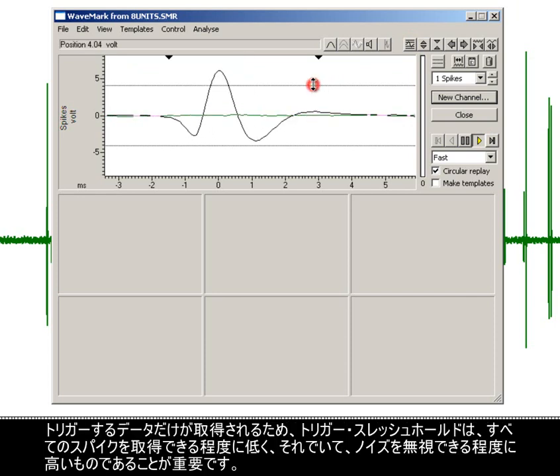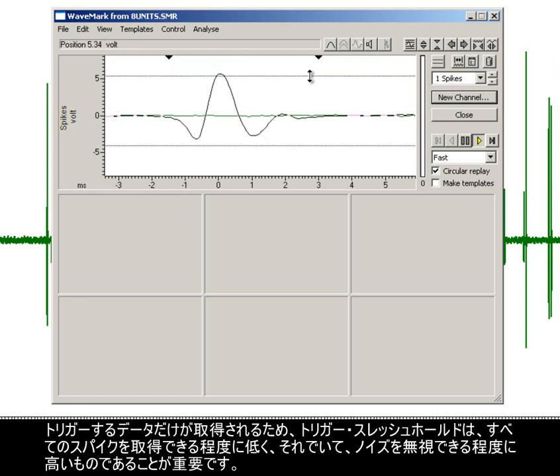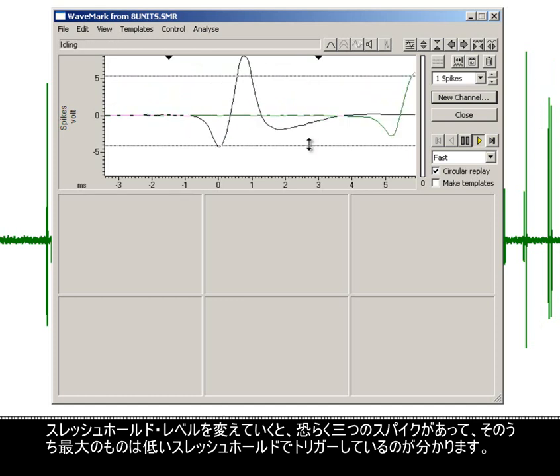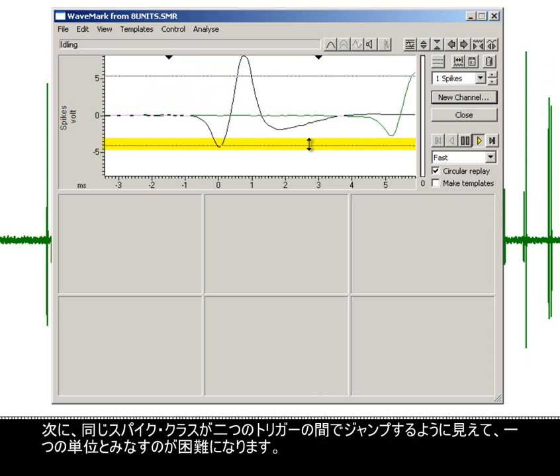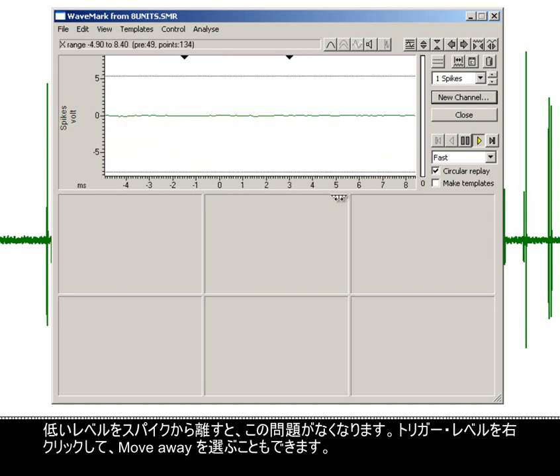Only data that triggers will be captured, so it is vital that the trigger thresholds are low enough to capture all spikes but high enough to ignore noise. Changing the threshold level, you can see that there are probably 3 spikes, the largest of which is triggering on the lower threshold. There can be cases when a spike class triggers on both the upper and lower thresholds due to slight amplitude variations. The same spike class then appears to jump between the 2 triggers, making it harder to treat as one unit. Moving the lower level further away from the spikes will remedy this. You can also right-click a trigger level and choose Move Away.